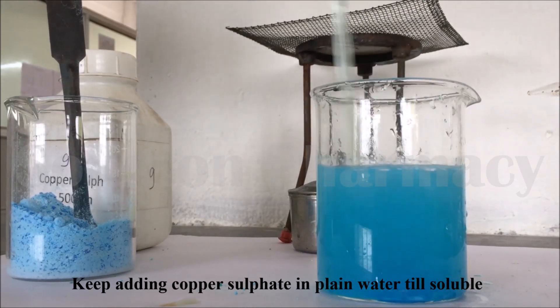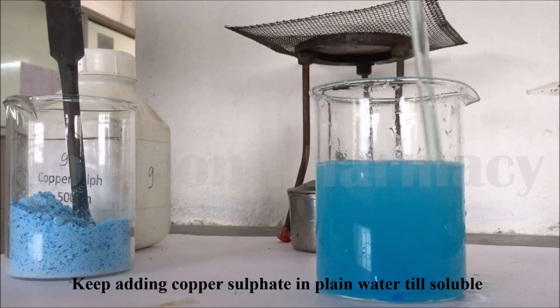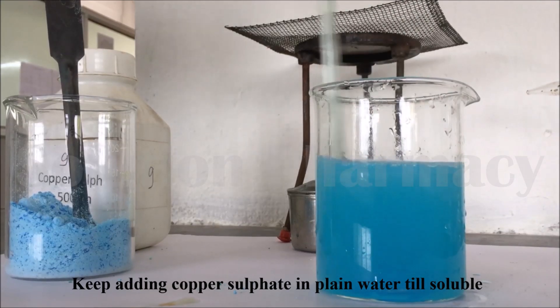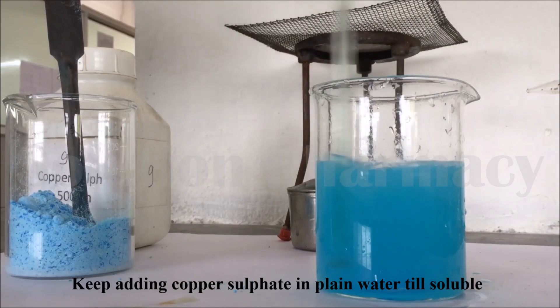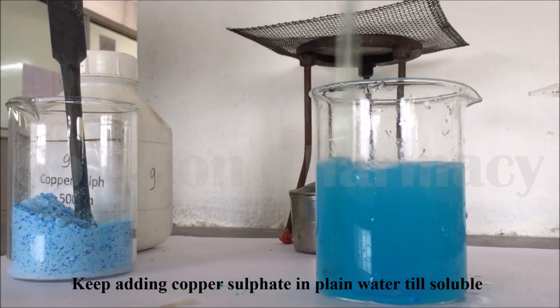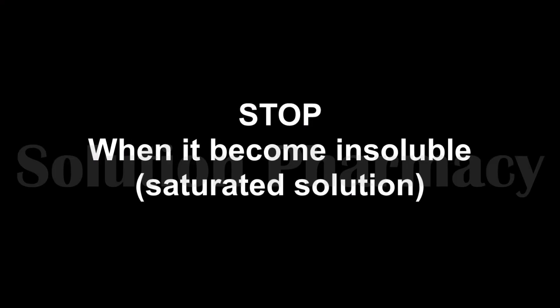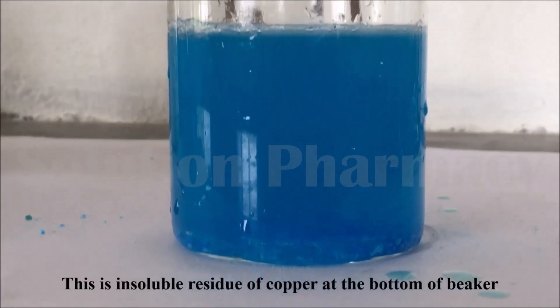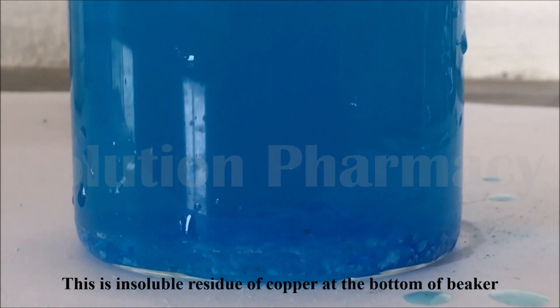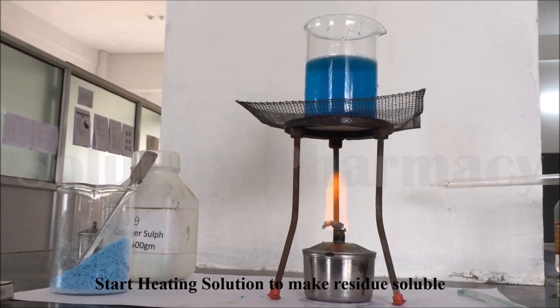Repeat this process: again add a small amount of copper sulfate and completely dissolve it by stirring with the glass rod. By adding more and more copper sulfate in water, after some time there will come a point after which no more copper sulfate will dissolve in water. This point is called the saturation point and the solution is called a saturated solution. Stop adding copper sulfate when it becomes insoluble. Here you can see the insoluble copper sulfate at the bottom of the beaker.